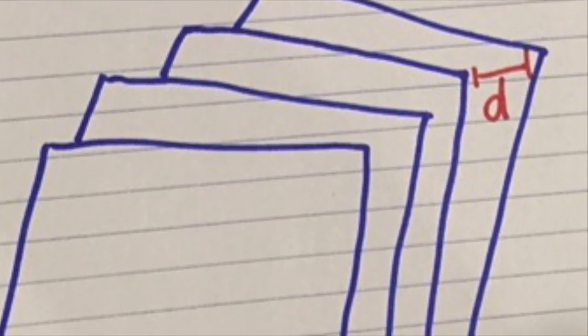Knowing the d spacing gives us a piece in the puzzle to figuring out the crystal structure of alum experimentally, because it shows how far apart the layers of the structure are. That ends our alum adventure for now.